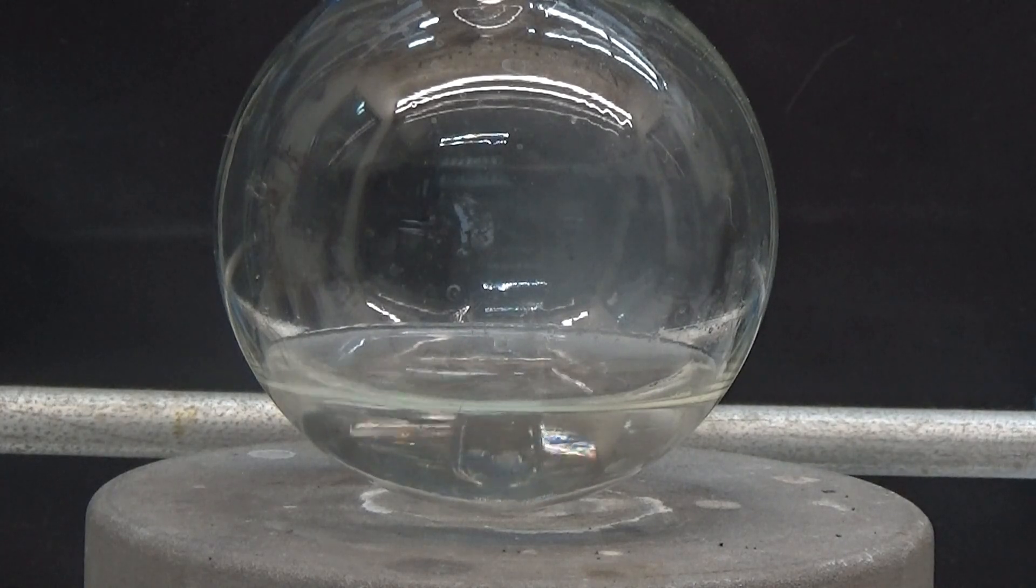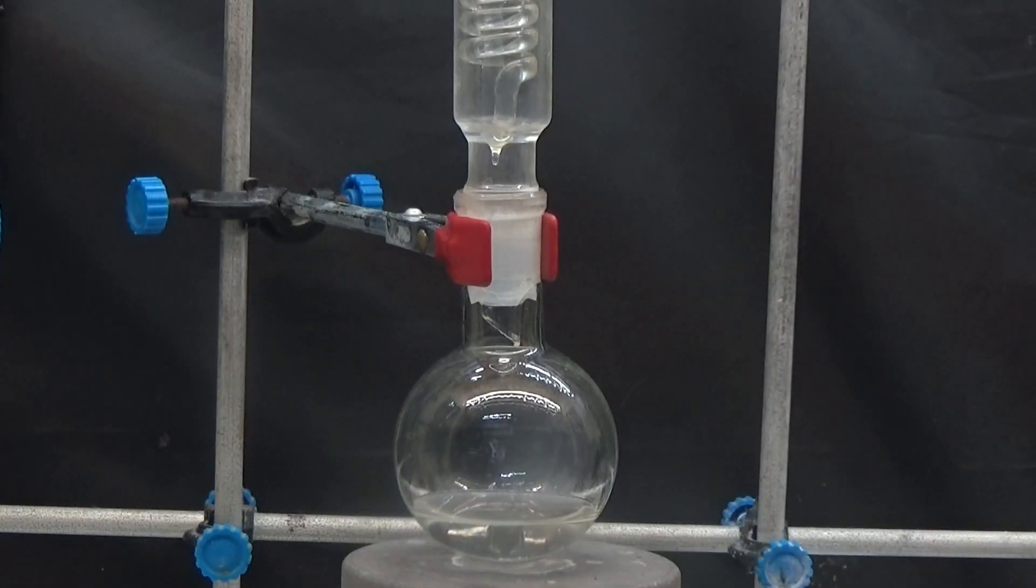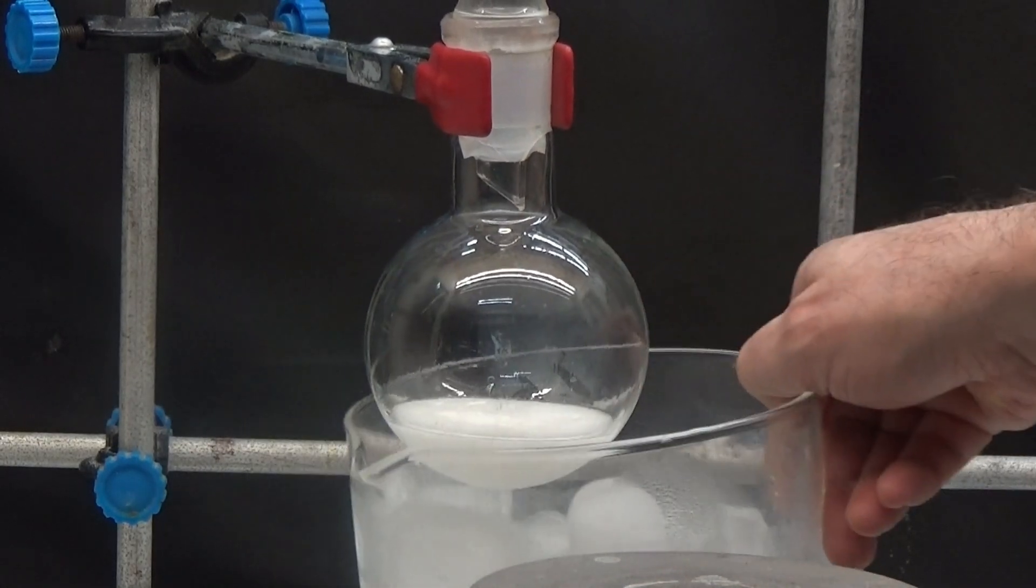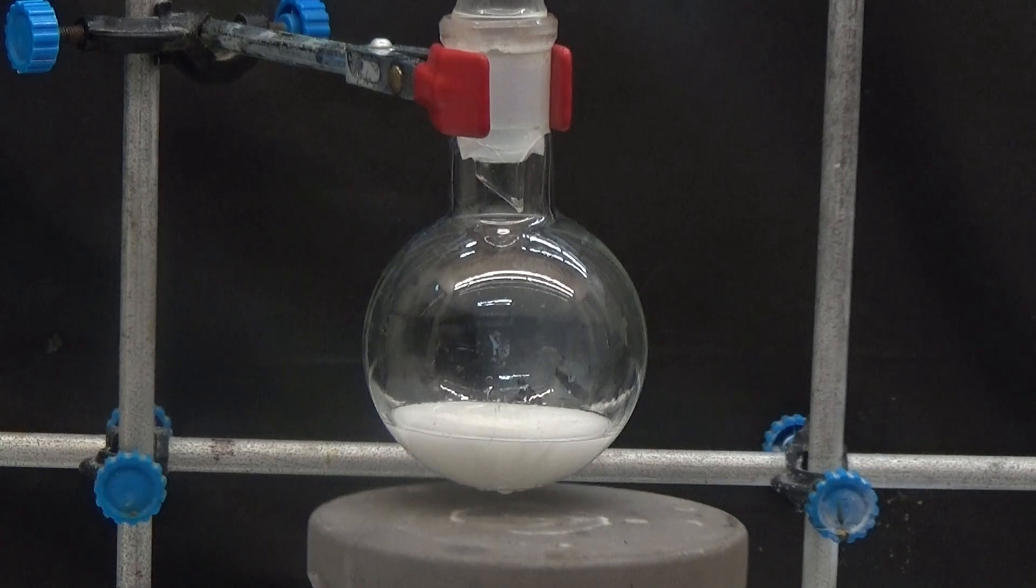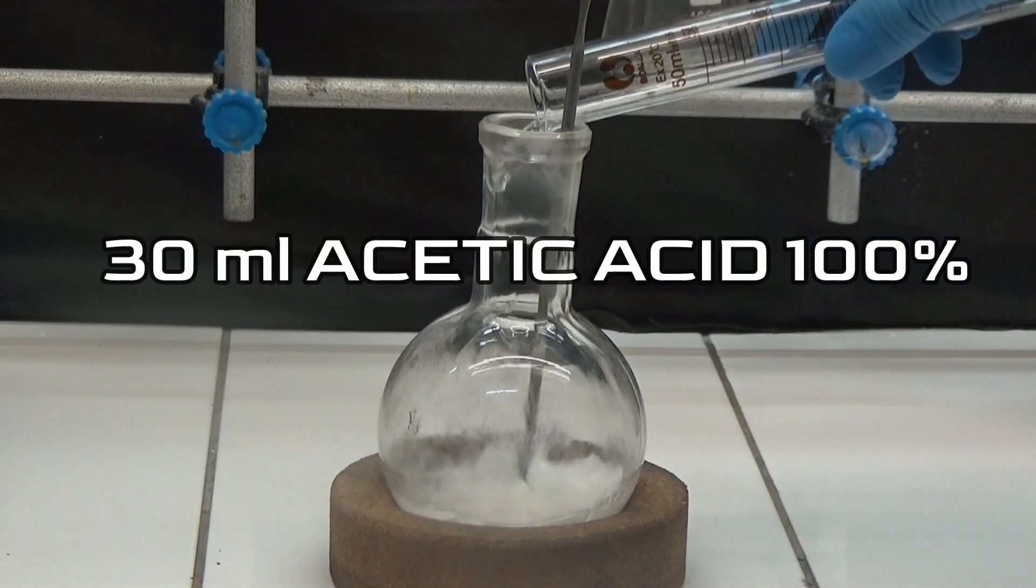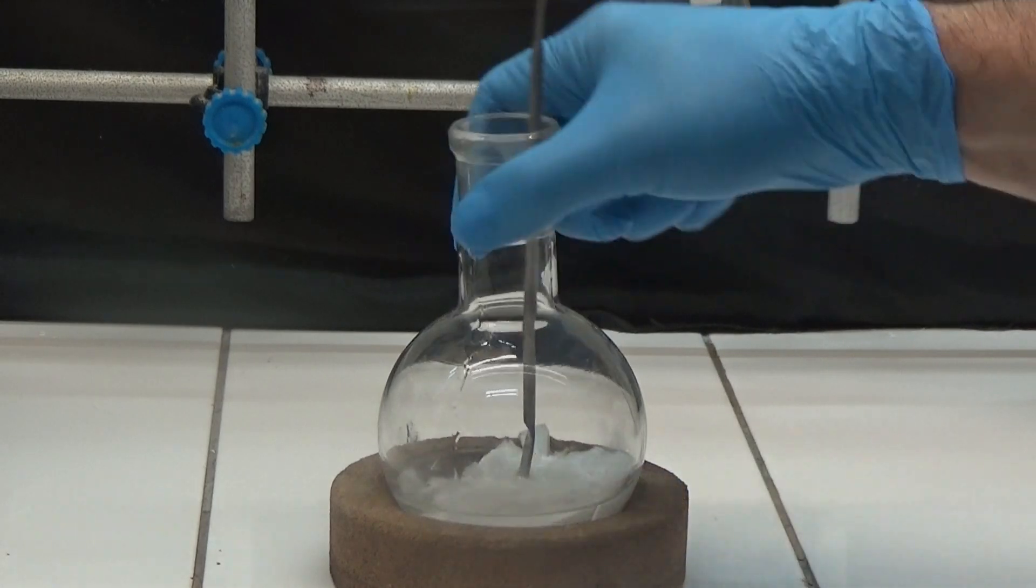After all the acid has dissolved, we let it cool to room temperature and then take an ice bath to cool the succinic anhydride to crystallize. We produce a white solid that is dispersed with 30 milliliters of 100% acetic acid.